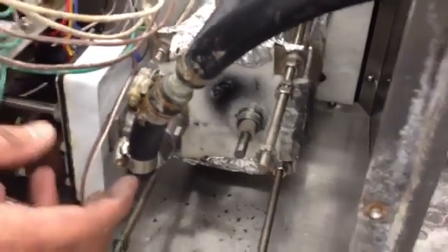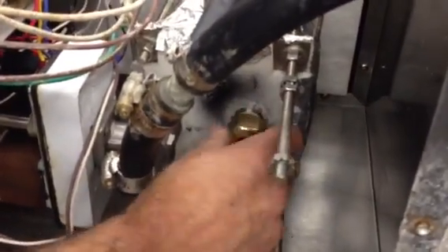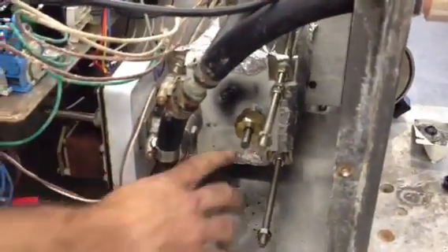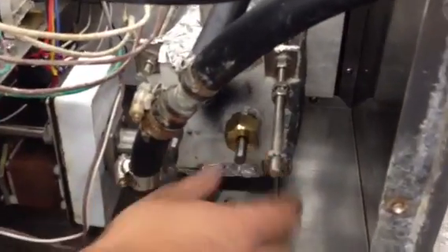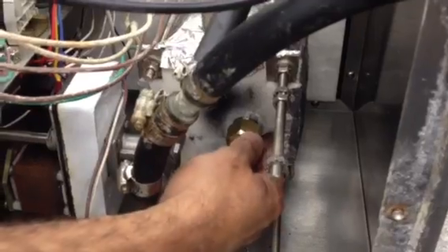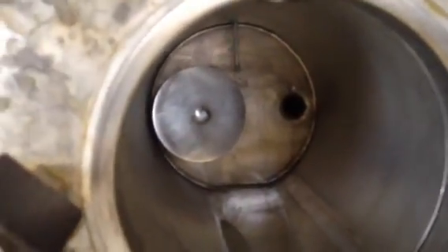We'll finish tightening it once we get the motor installed. So we slide the packing nut back on. And you can just do this hand tight for right now. We'll tighten it correctly later on. At this point, you also want to make sure that pushing on the packing and compressing the packing, you haven't slid the agitator up inside the vessel at all. So go around the front of the machine and slide the agitator down as far as it'll go inside the vessel so that the Teflon's seated on the bottom of the vessel. Okay, that looks good.